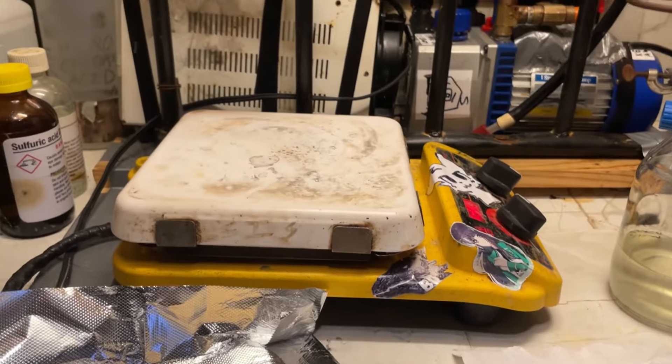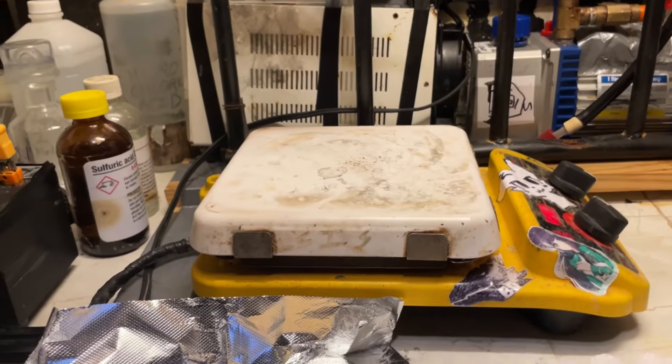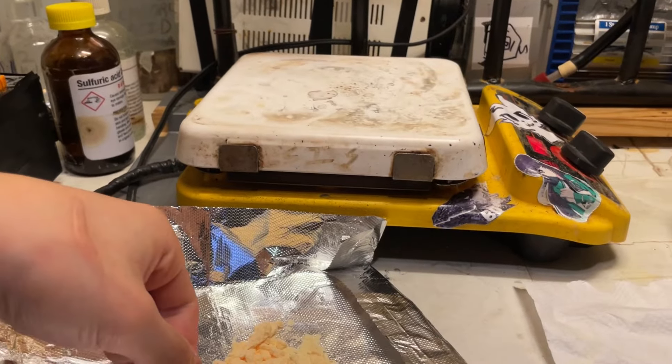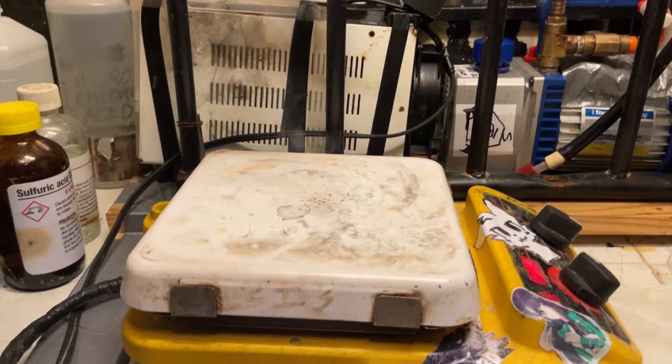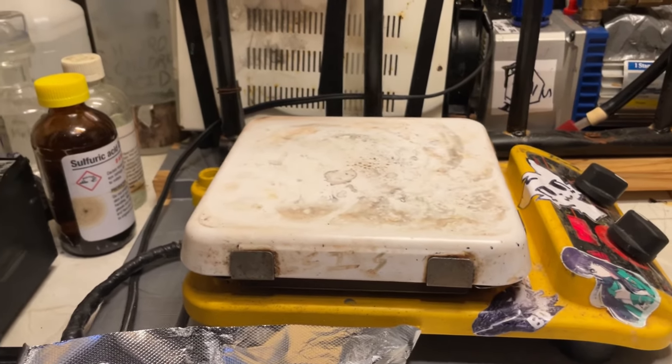Hot plate's at 225. So it's not decomposing. So I think I'll just crank the temperature up a bit more. I'm too lazy to go ahead and do a proper melting point test with oil bath and capillary tubes. So I'll set this to like 250 Celsius. Okay, that didn't work. So the hot plate's at 430 Celsius now. And you can see, if we simply put a bit of this on here, it profusely fumes and disappears. So I think that's a good sign.